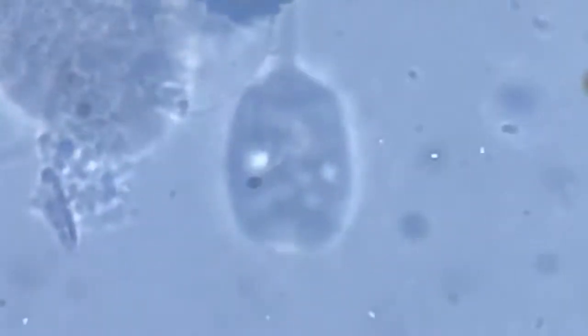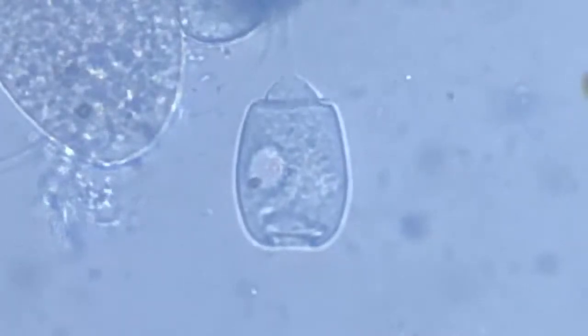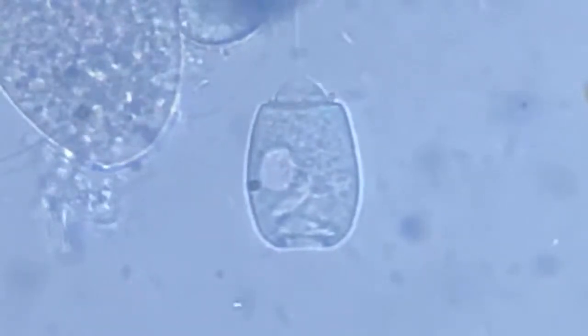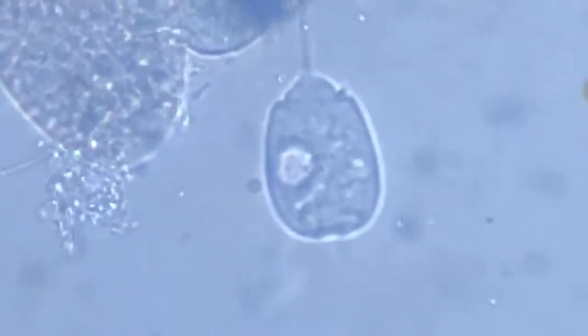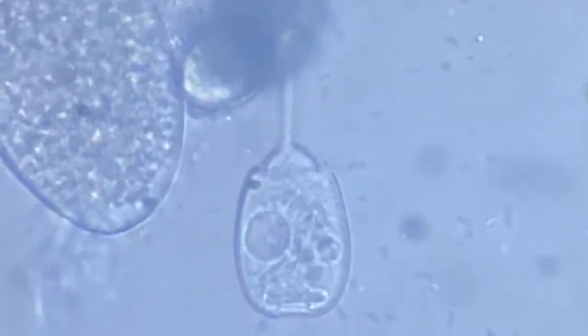This is pretty shaky, so I have to shift somewhere. Let's look at some other portion, some other individual. Yeah, this one looks promising. Again, there are bacteria at the same site, that is the junction of the stem. Is there something delicious or nutritious in that segment? It went back, so it's active. We'll bring him at a different focus, like this.